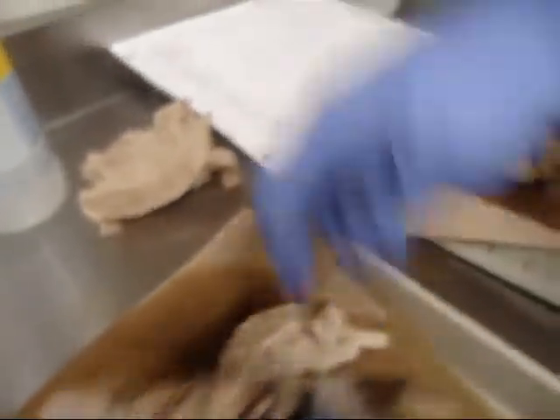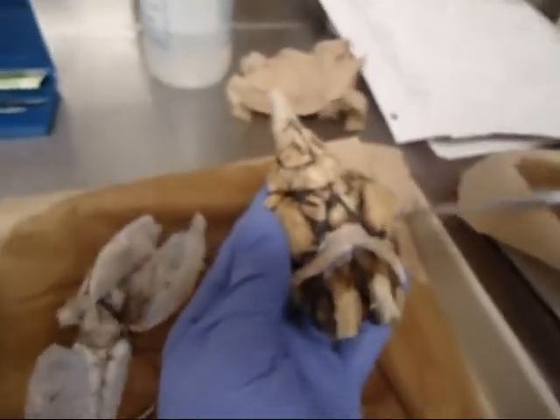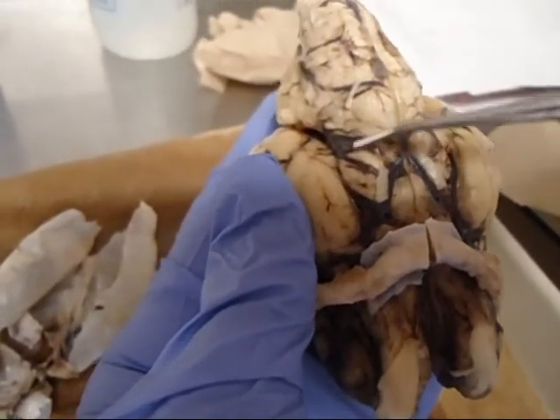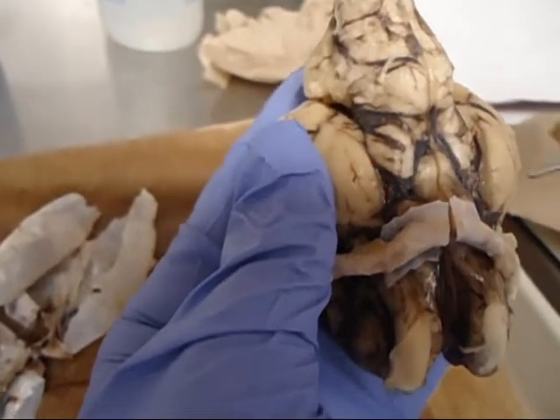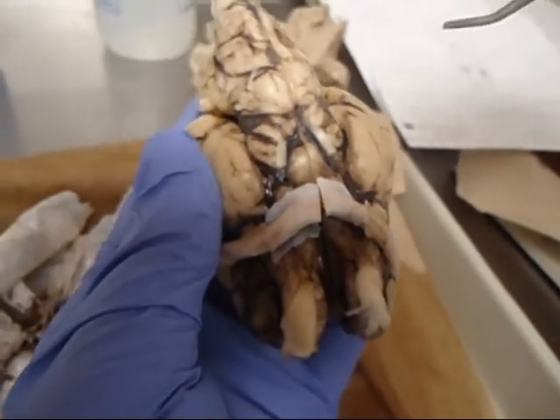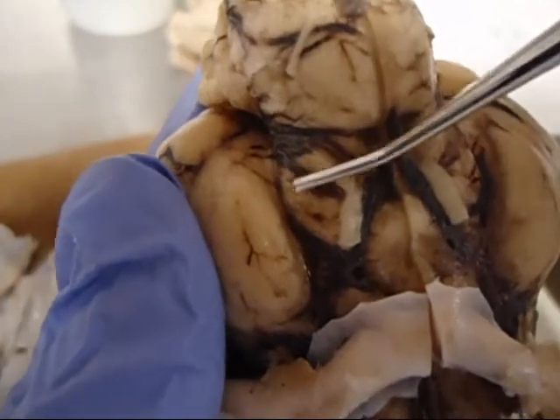Yes, the cerebral peduncles are going to be from a view like this, most typically. Here's your optic chiasm, here's your hypothalamus, mammillary bodies. The cerebral peduncles are the lumps that surround that. And right on top of the cerebral peduncles are the oculomotor nerves. So if you can locate the oculomotor nerves, right underneath them are the cerebral peduncles.